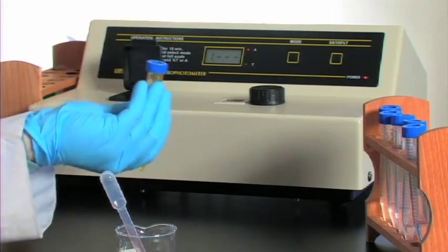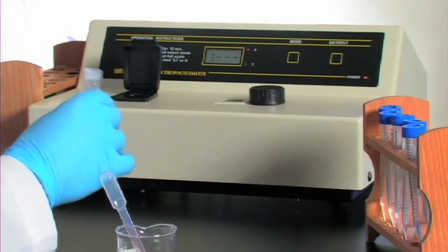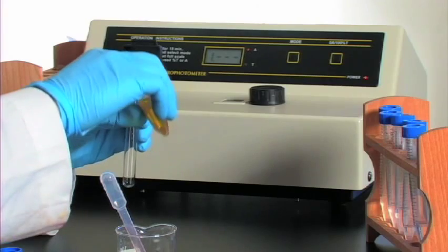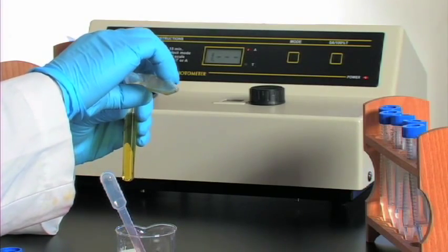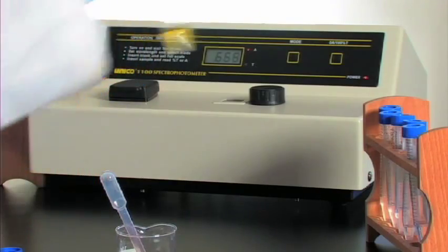Mixes it, stopwatch is on now. He's timing even as he's transferring, so it's not a real rush but let's see how fast this is going down.